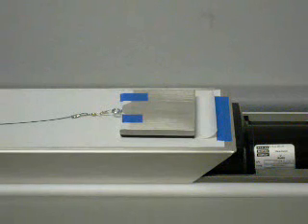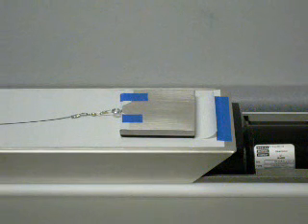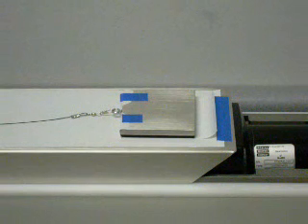For film specimens, tape the edges of the 120 millimeter or 4.5 inch square film specimen to the back of the sled, using adhesive tape and pulling the specimen tight to eliminate wrinkles without stretching it. For sheet specimens, tape the 63.5 millimeter or 2.5 inch square sheet specimen to the sled face with double-faced tape. Keep the machine direction of the specimen parallel to the length of the sled.